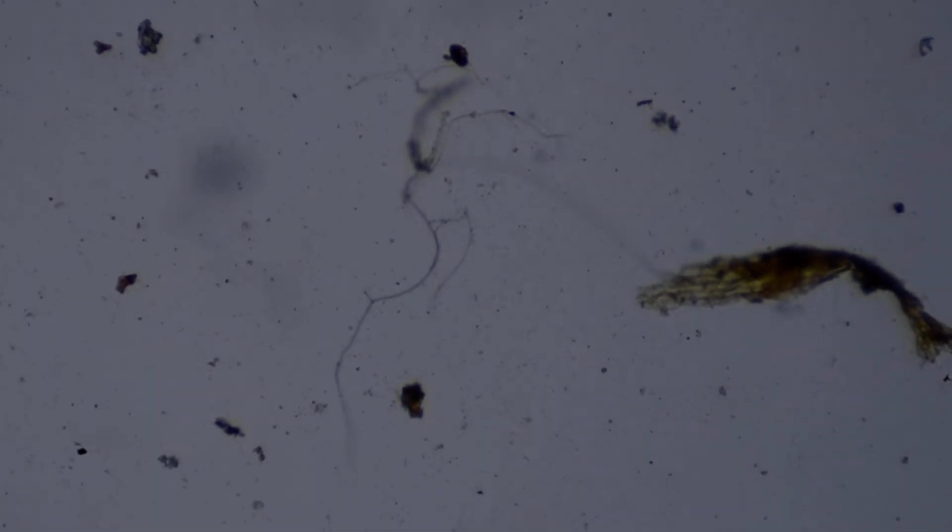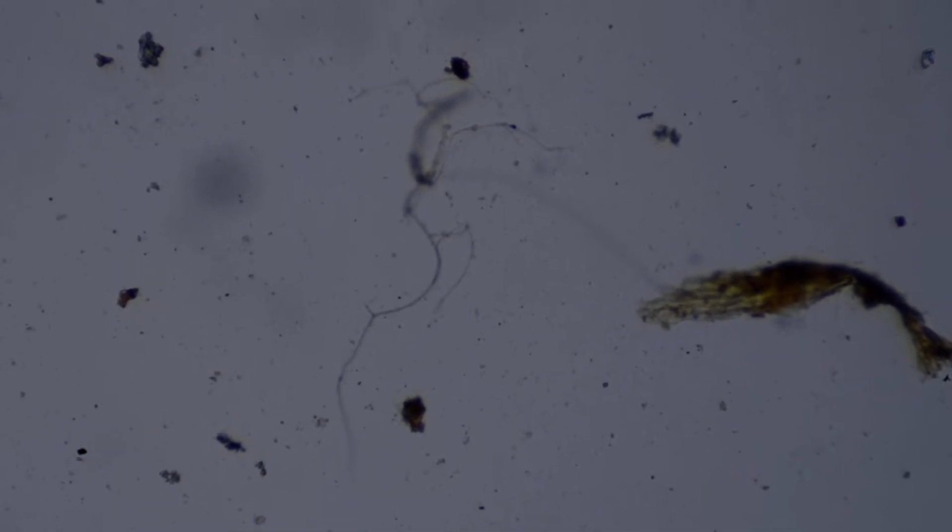They actually move around because of a phenomenon called Brownian motion, which is something to do with the thermal properties of atoms, and I can't really explain it in any more detail than that. But it's not through their own locomotion that they're moving. They kind of glide and slide very, very slowly. So you'd need a time lapse to see the true movement of bacteria. So yeah, this is times 100.